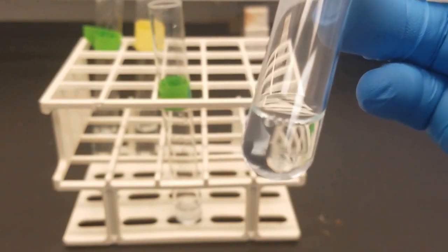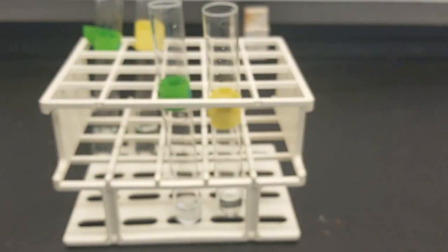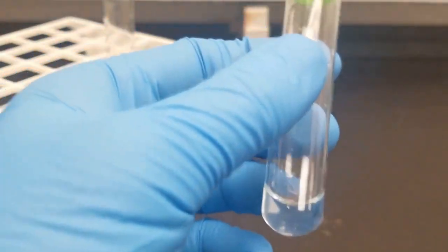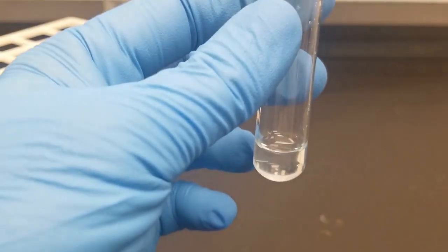And you can tell all the precipitate is gone. So now upon the addition of acid, in this case 6 molar nitric acid, we should see our precipitate reappear. So you have to be a little careful with this stuff. You're adding acid to a base, and so it's a little bit sketchy. Let's go ahead and see what happens. Add very slowly, kind of drop-wise.